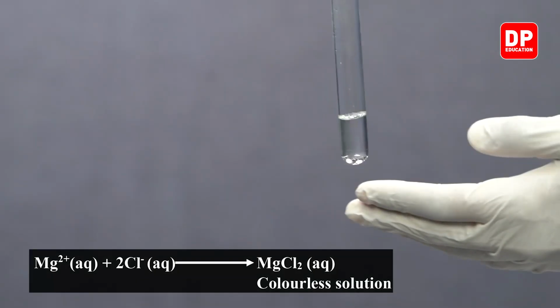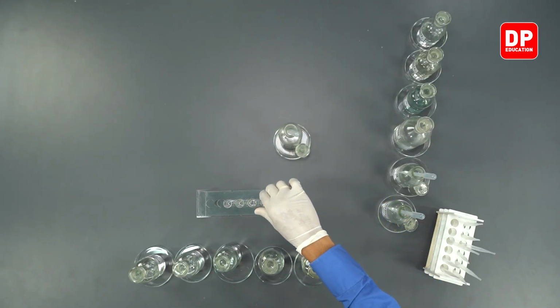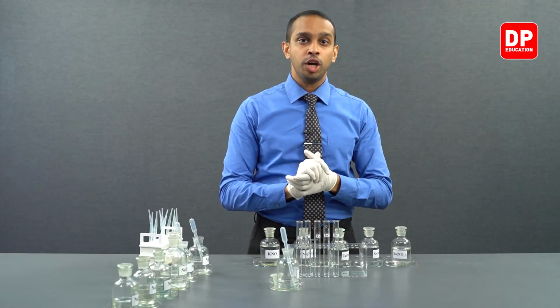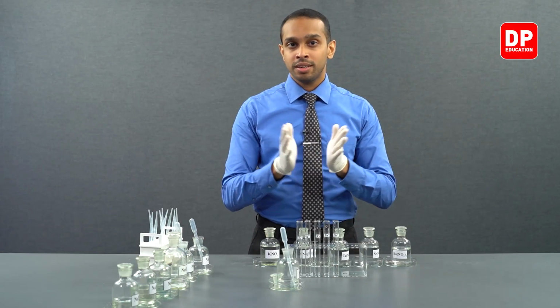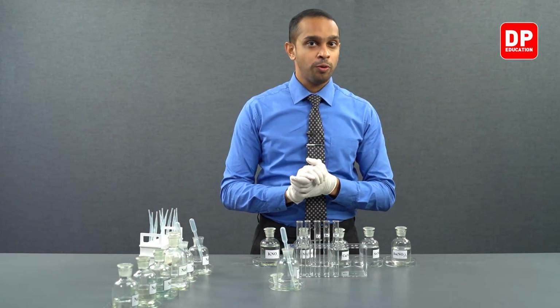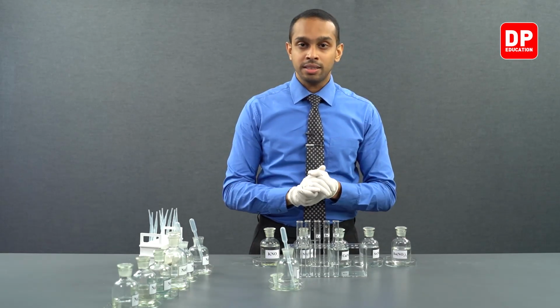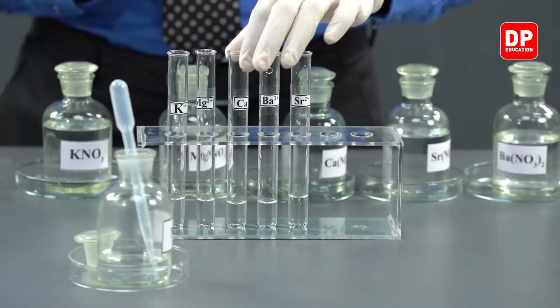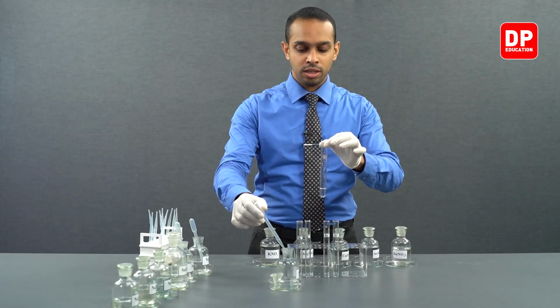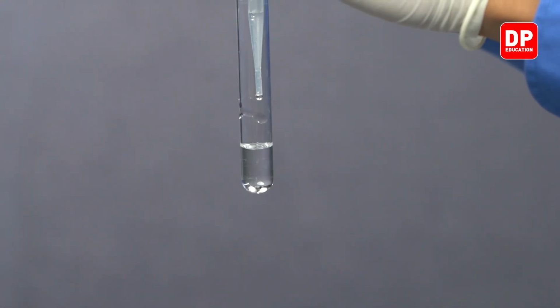Again, we expected this outcome because the majority of the group 2 cations do not form precipitates with most of the uni-negative anions, and especially halides do not form any precipitates with any of these cations. But let's move ahead and add sodium chloride to all of these cations just to observe what happens.